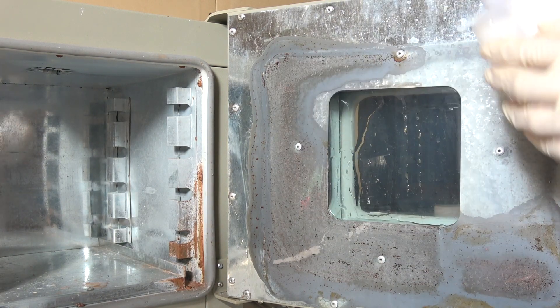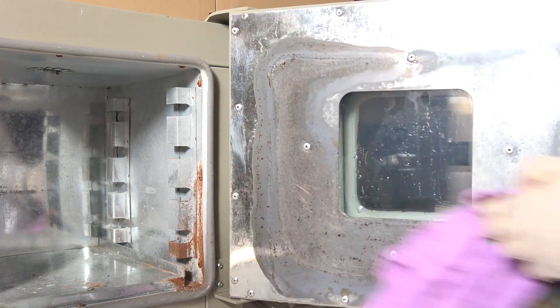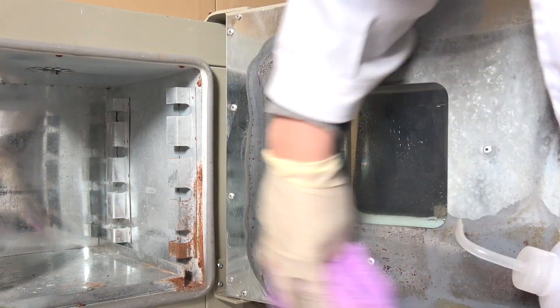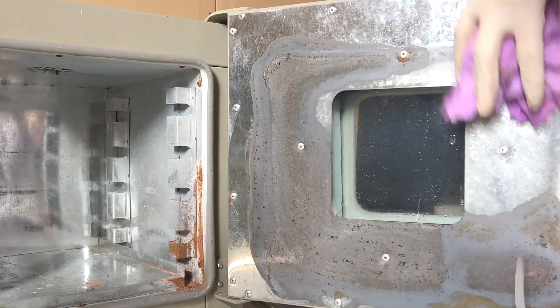And this is the end of this video. Okay, just kidding — we are far from done yet. The zinc coating that was once on the surface must be restored, else all the hard work we just did would be for nothing.